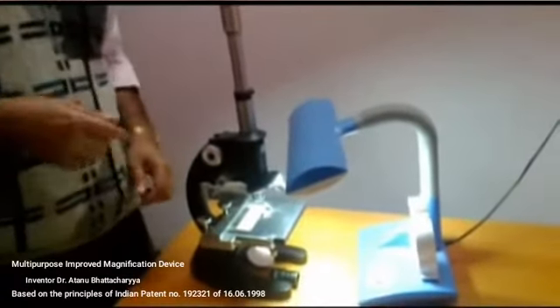The erect and magnified image of the ant can be seen through this device. Now I am trying to show you the image. That is the head of the ant. The erect image of the dead ant is being seen here.